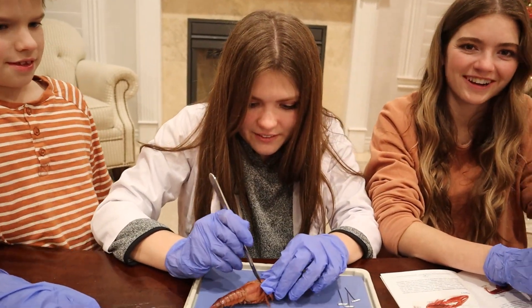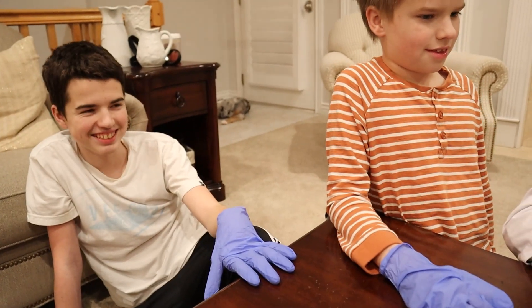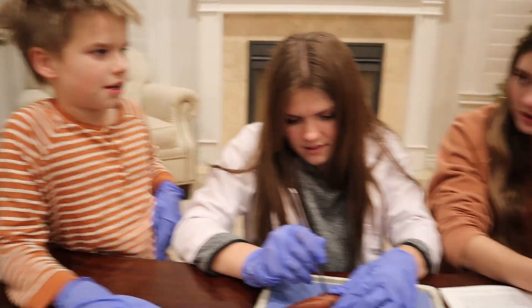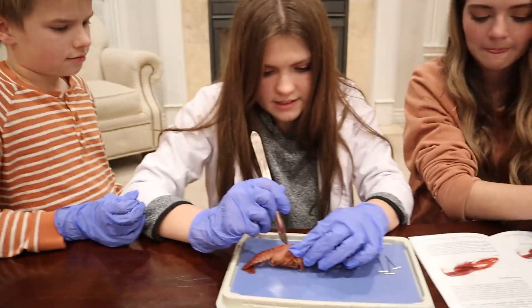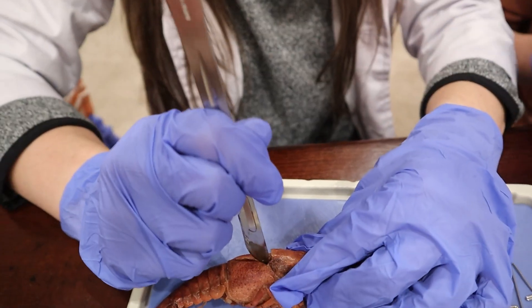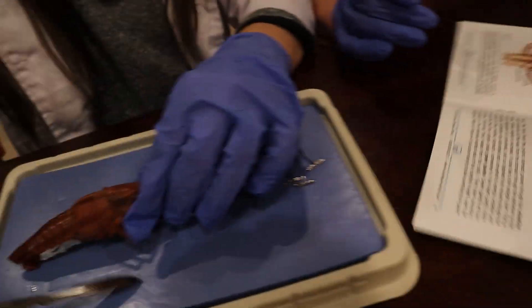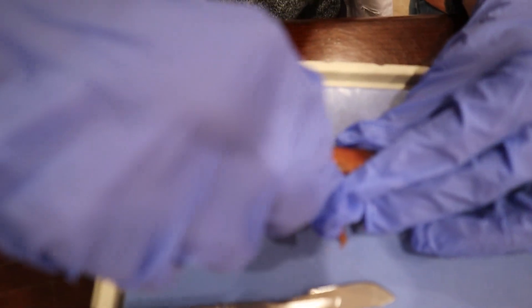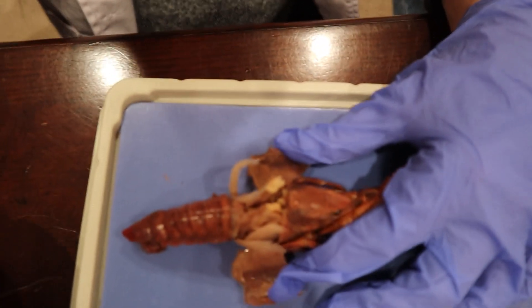Now what? Cut three — oh, you did cut three. Oh my goodness! That's what it's supposed to look like. We're supposed to look at it from the top? I heard a pop! It reeks! Actually, I don't smell it. I say just throw it away. No — this is science. I have no idea what I'm looking at.